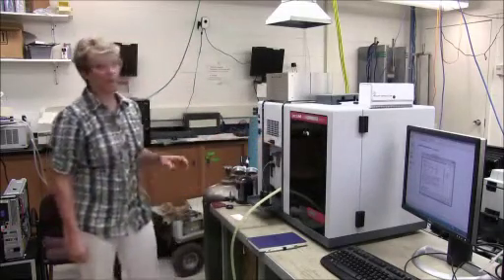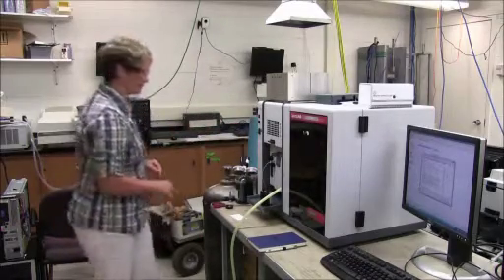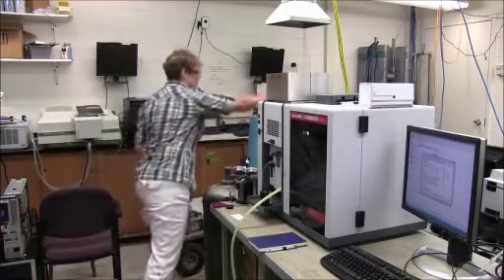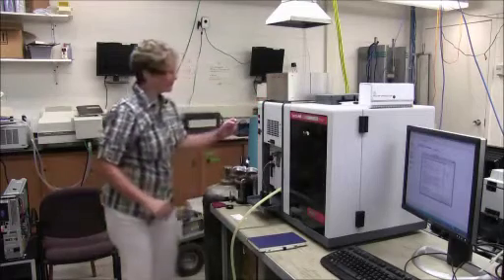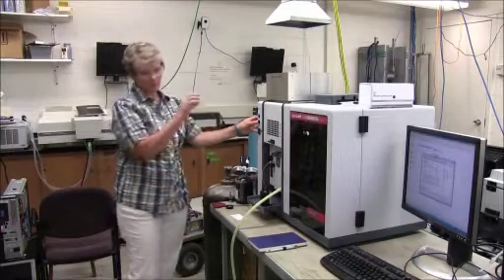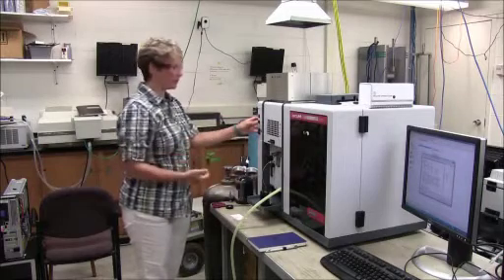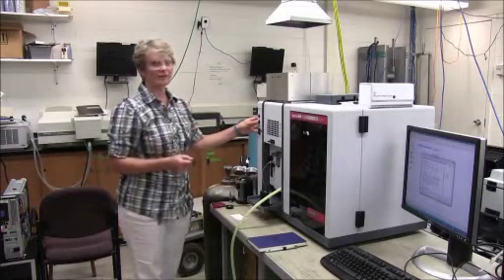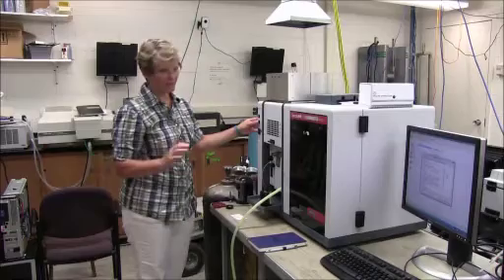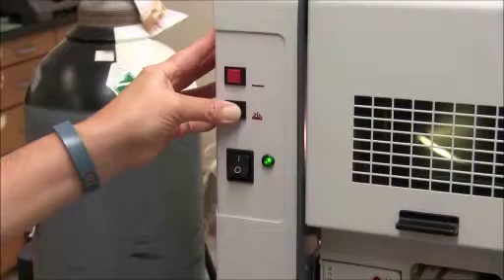So at this point here, we would want to light the burner, and that's how we optimize the lamp. Our gases have already been turned on. As I said before, I will turn on the air and then the acetylene. And then we have a button here which shoots a small flame into the burner area. The gases are going up through the burner at the moment, and it starts the flame. So it sounds like a sputtering, and then as soon as it's a continuous sound, you know your flame is lit. You can also see it to a certain extent through here.